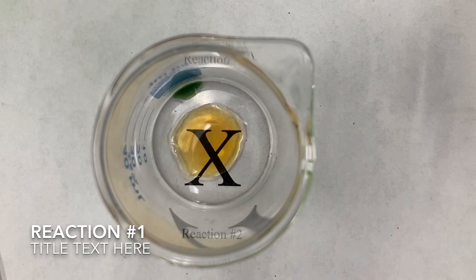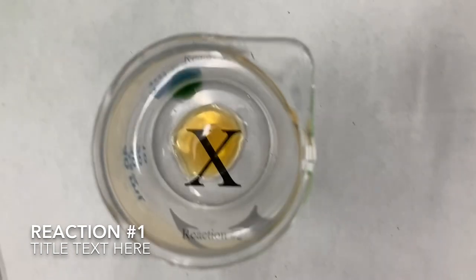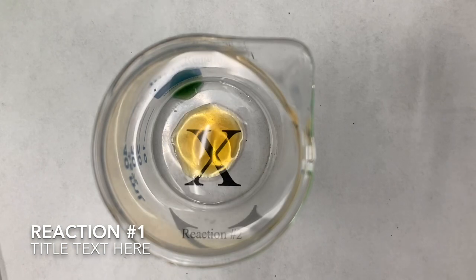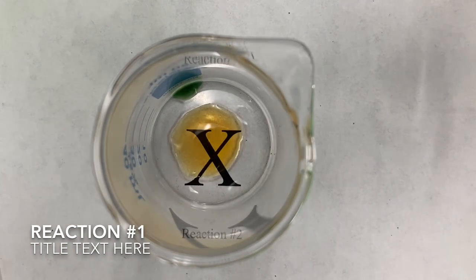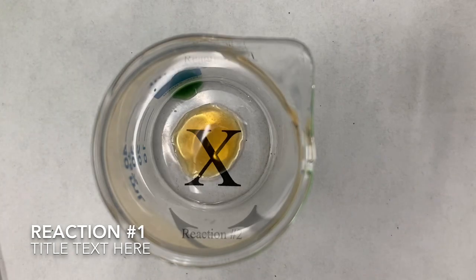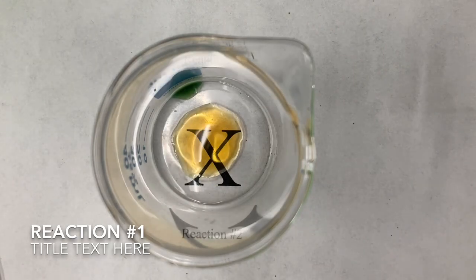Okay, next, take a moment to predict what's going to happen when we add hydroxide to this reaction. So NaOH. Here, when I add hydroxide, it's going to react with the hydrogen to form water. So let's see which way this will shift equilibrium when I add some hydroxide.